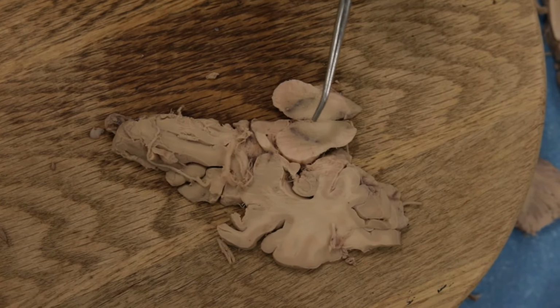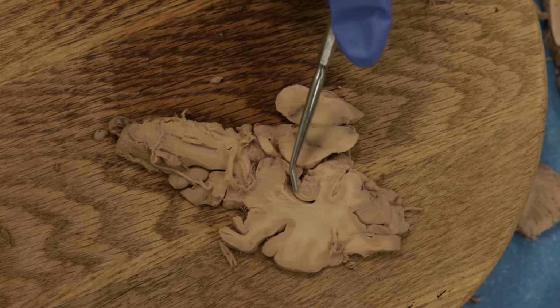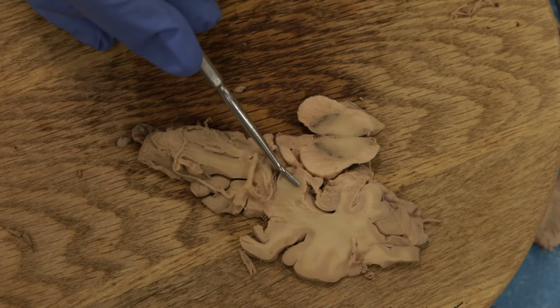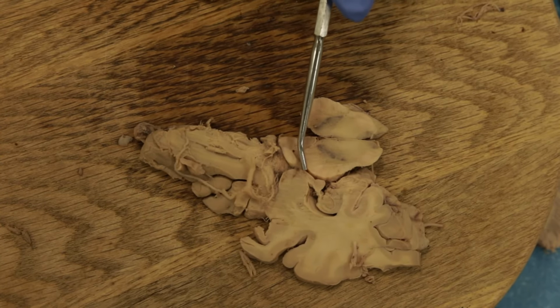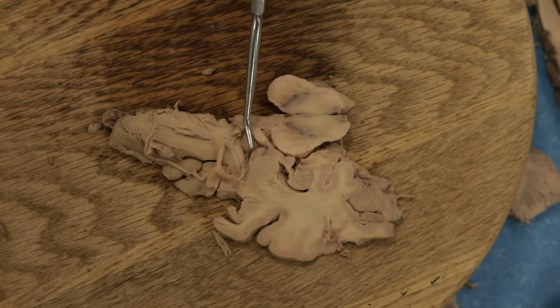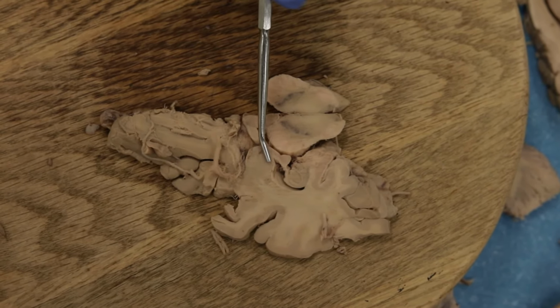Now if we move out here into the temporal lobe, one other important thing to point out. This again is the temporal horn of the lateral ventricle. We've been pointing out the hippocampus in the floor of that all the way up. But now notice if we move up here, we've got a homogeneous mass of neurons. This is the amygdala. How do we know it's the amygdala? Well, this is the uncus. Remember, the uncus lies right next to the cerebral peduncle. The third nerve comes out right here. We can't see the third nerve here, but it lies right adjacent to the uncus as it exits the midbrain. So this is the uncus, and the amygdala is just lateral to the uncus.